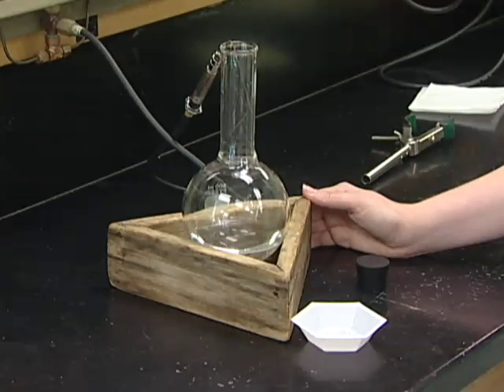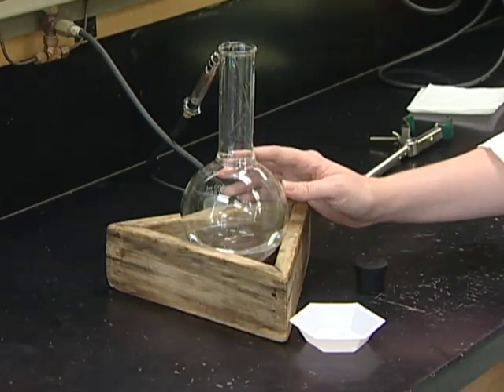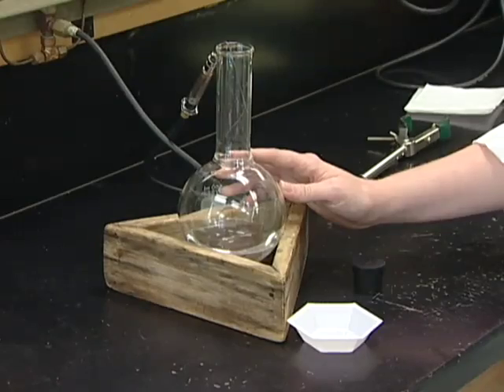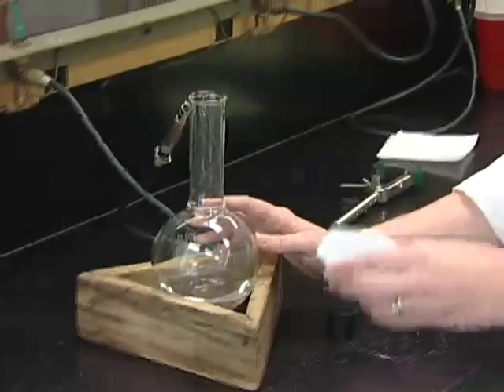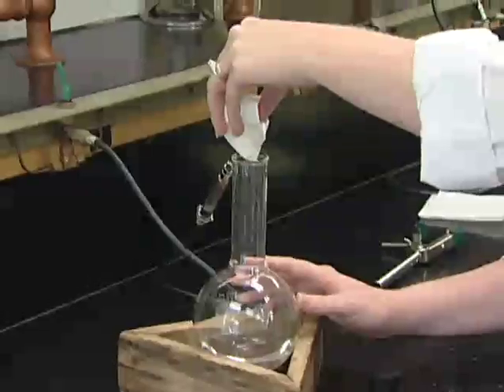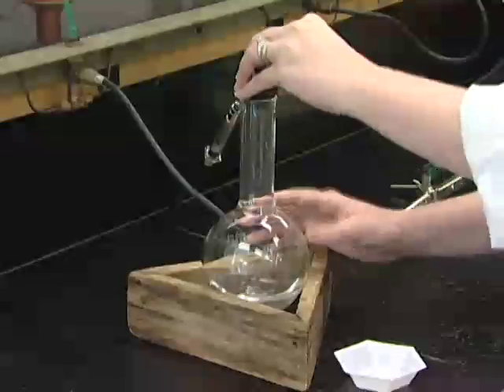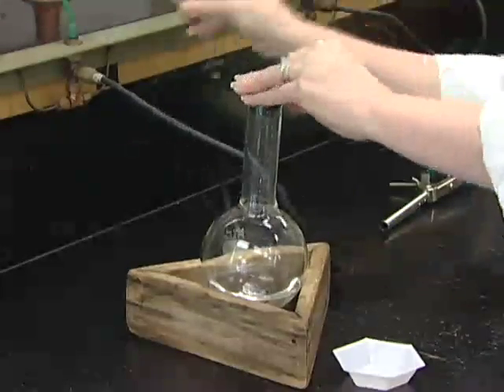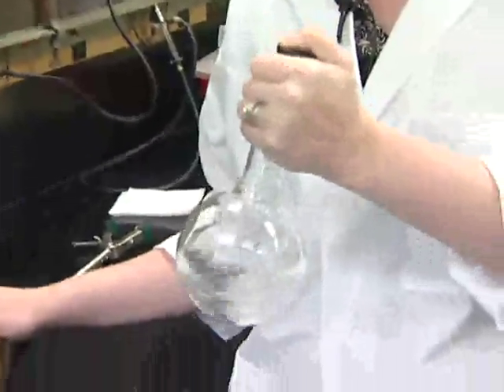Making the sodium sulfide solution is similar to making media in that we're going to boil water, but we will do it this time under straight nitrogen instead of nitrogen CO2. After you bring it back down to room temperature, you'll take your good sulfide crystal, which has been washed off, and put it into the flask. Now we're going to stopper this and pull out the gassing probe because sulfide can be toxic, and we will swirl it to get it to dissolve.